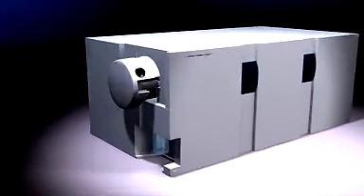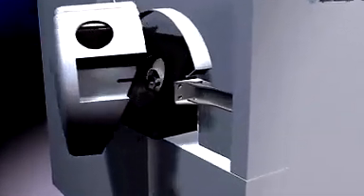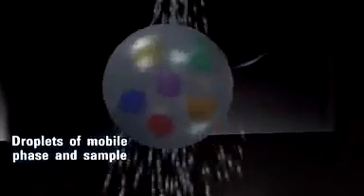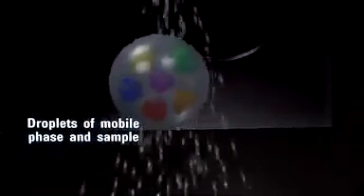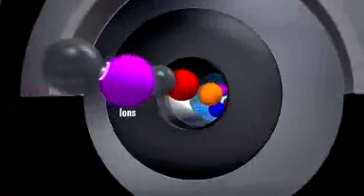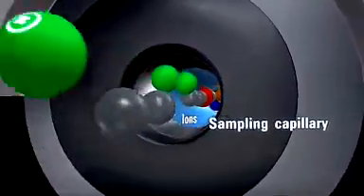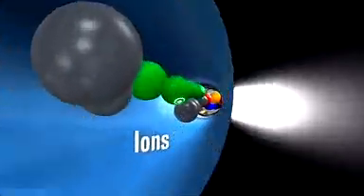Great sensitivity starts with superior ionization technology. Agilent's LC-MS ion sources use our patented nebulization technology and high-volume counterflow drying gas. Together, they reduce noise related to incomplete drying of solvent droplets and keep the sampling capillary and ion optics cleaner for reduced maintenance.